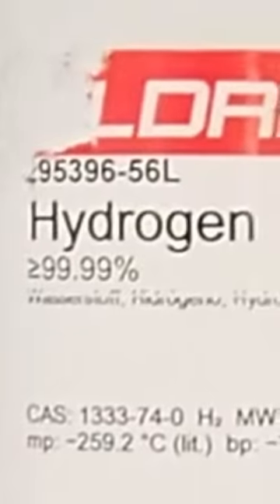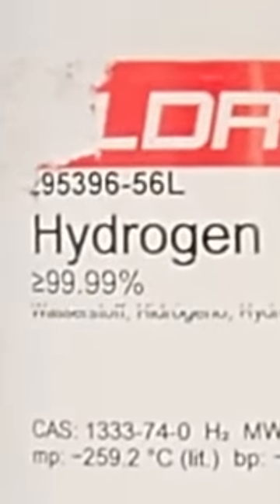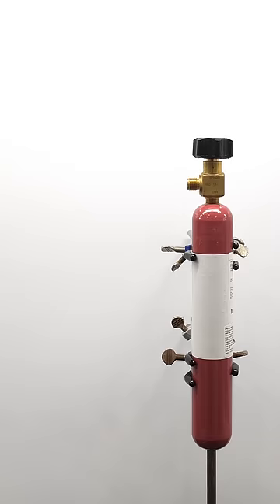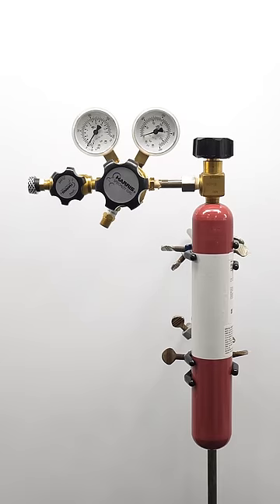This little gas cylinder is filled with extremely flammable hydrogen gas, and I really want to light some of it on fire. To get the hydrogen out of the tank though, I first need to add a regulator.